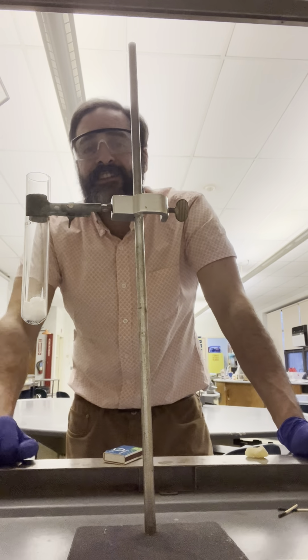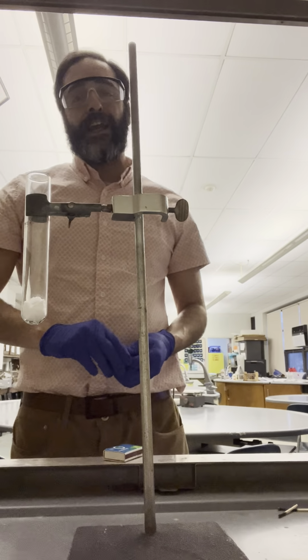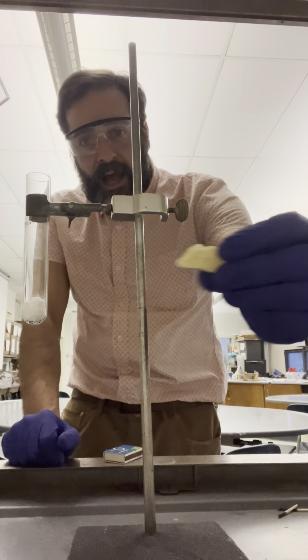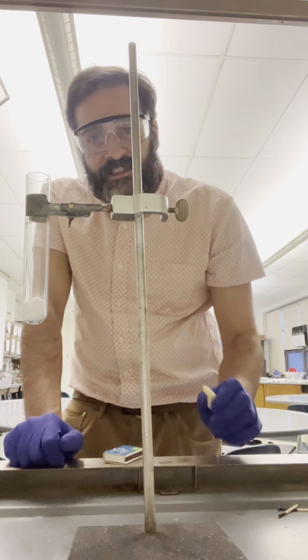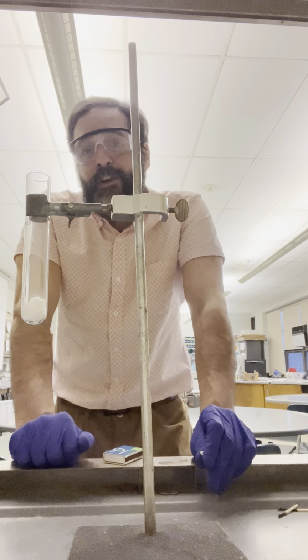The second part of this chemical reaction, which we're going to do in the exact same video here, is typically called exploding gummy bear, if you want to see other examples of this online. I do not eat gummy bears. You guys know me, I'm pretty healthy. I have a pineapple piece here. Essentially the same thing as a gummy bear. This has obviously some pineapple in it, but it's also got a lot of sugar. The sugar is what we're looking to react.